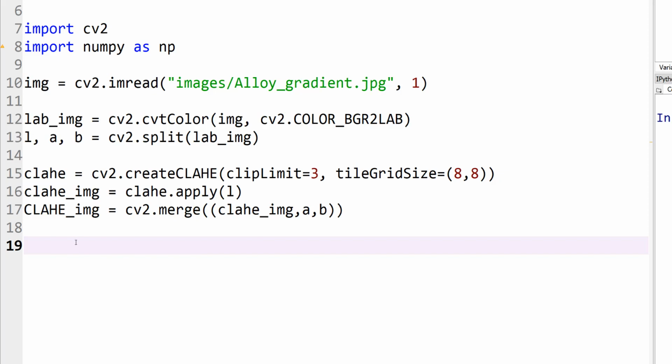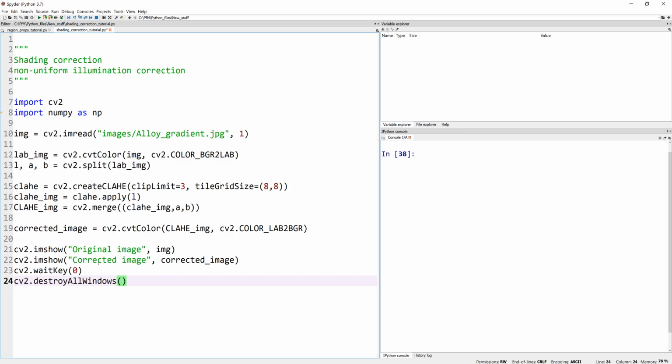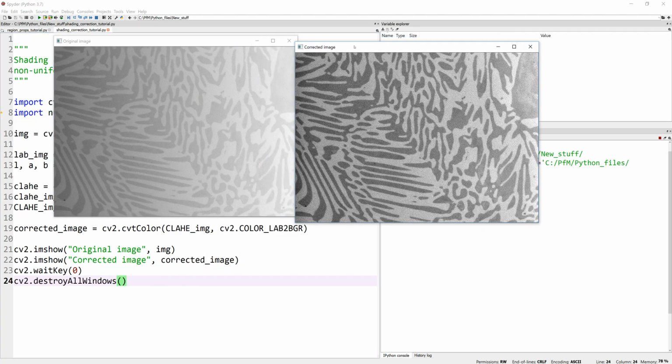And for that, let's use OpenCV's cv2.imshow. So I'm going to show the original image and corrected image, okay? And finally, I added this line because here, it's a merged image, but it's still a LAB space image. So I'm converting that from LAB to BGR, which is our color image, okay? So let's run all of these lines to see our before and after pictures, okay?